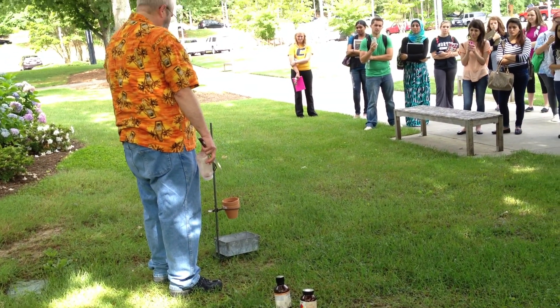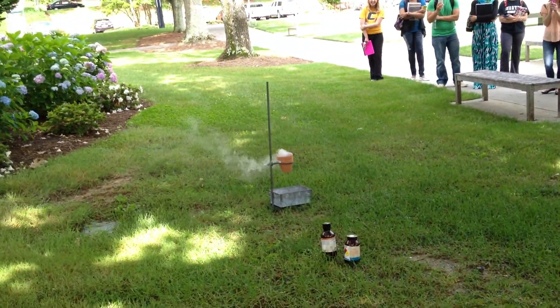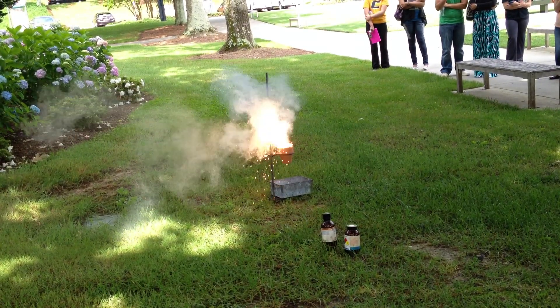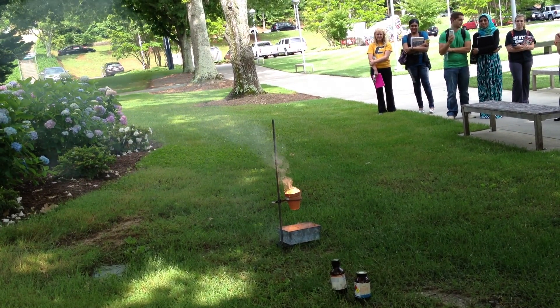Whichever way the lid's blowing, y'all be a little careful — there it goes. It takes a second, but it'll be very bright in just a second. You want to feel the heat from here. See the iron? It's falling out the bottom.